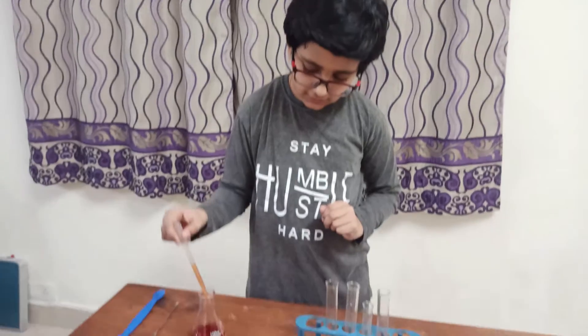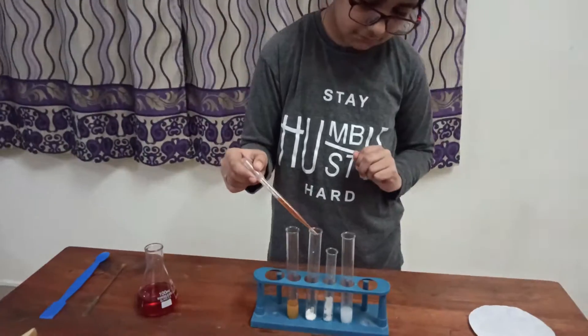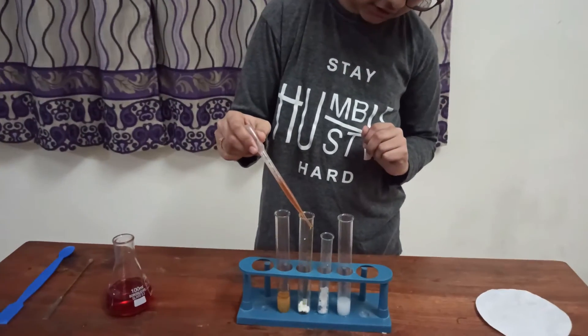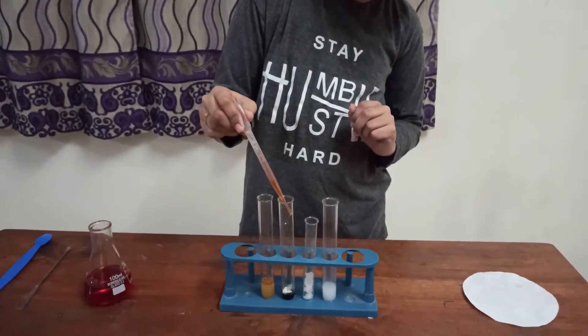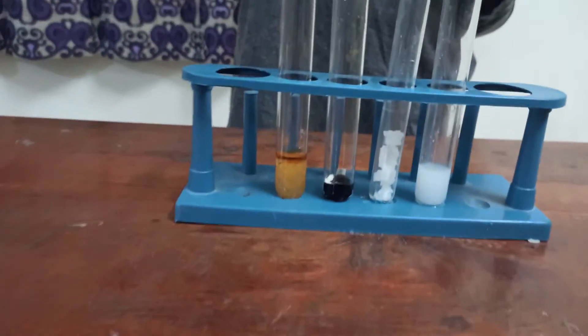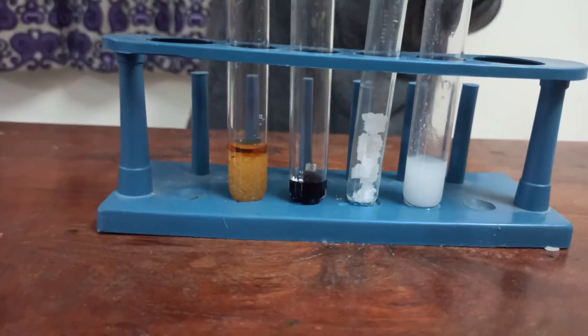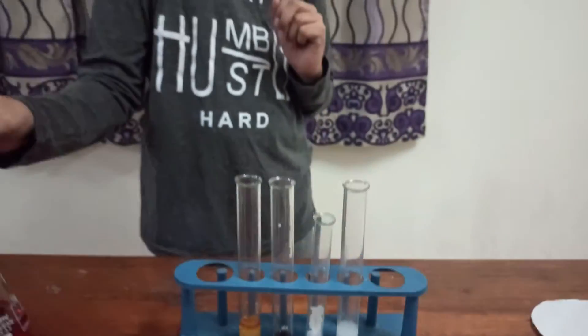So now, we are gonna add iodine to some corn starch. As you can see, it has turned a nice blackish purple color.